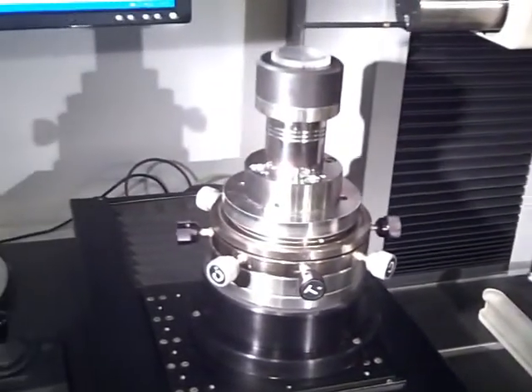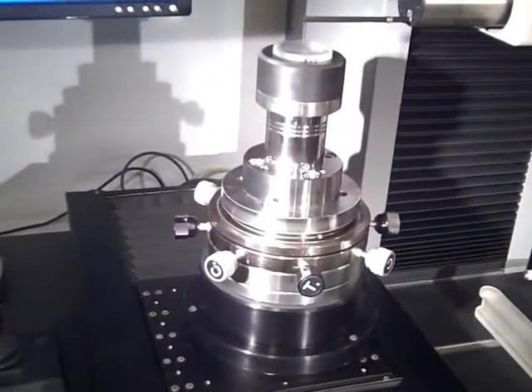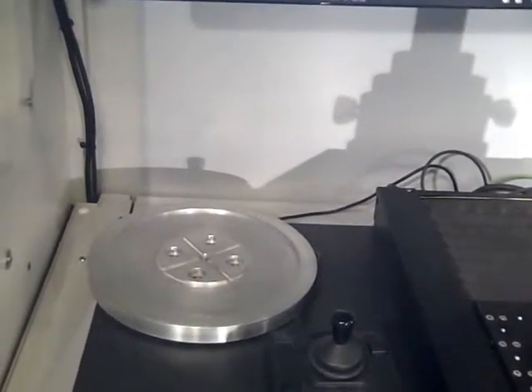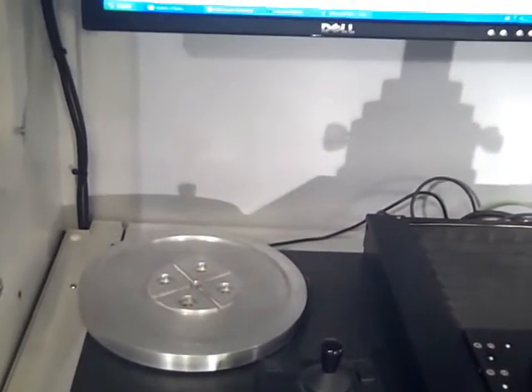Larger workpieces can also be placed on the air bearing system, utilizing work holding pieces and vacuum through the center of the rotary table.